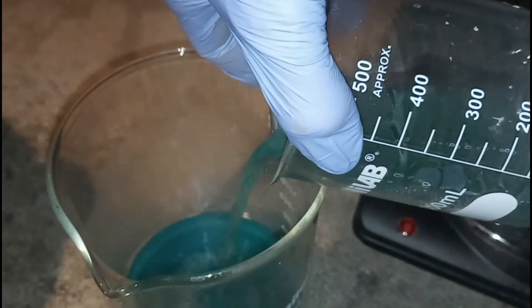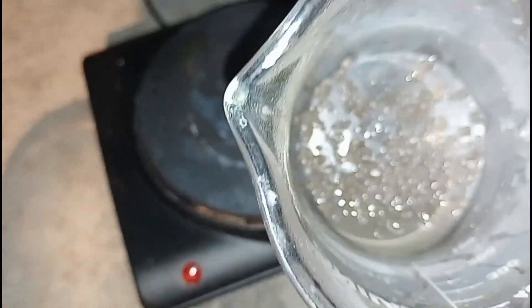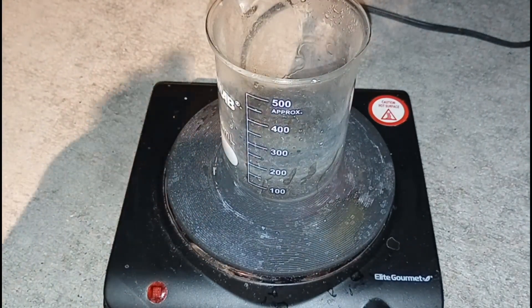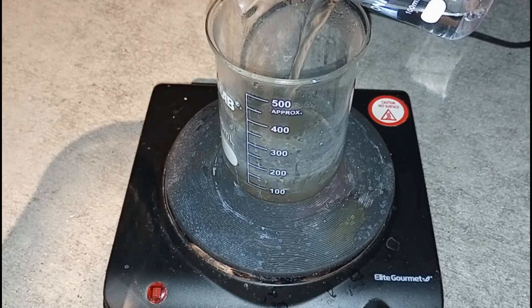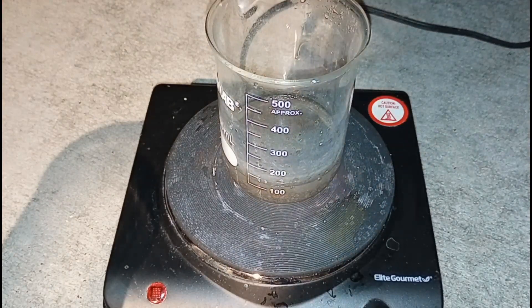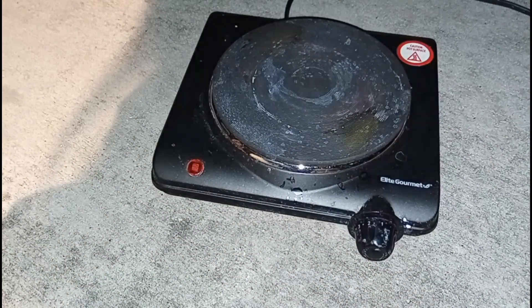So now we're going to pour the liquid off again — I think this might be like the fourth time we've done this. I can tell by looking at it that a lot more of the material is actually dissolving. I do think that in the first two videos the material was dissolving, it was just plating back out or precipitating back out. There goes another 100 milliliters of vinegar and another 50 milliliters of hydrogen peroxide. I think this will be the fifth time that we've done this — pour off the liquid and start over with fresh acid.